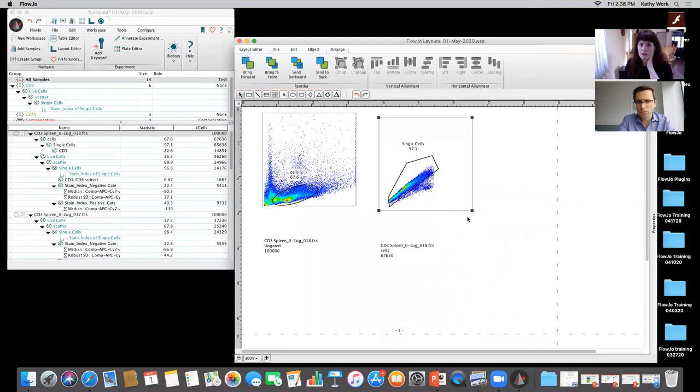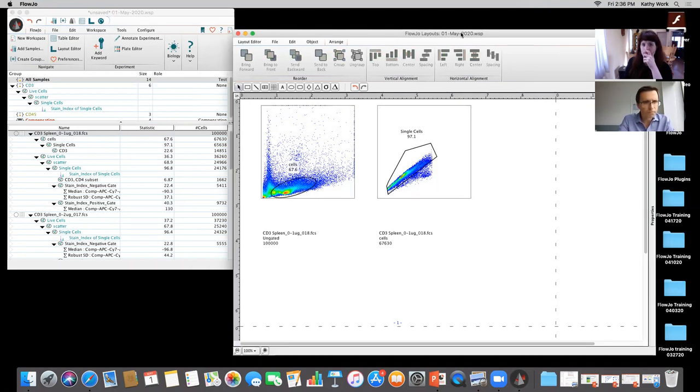But yeah, typically what you do to line things up is to drag them and align them to one specific top or bottom or whatever you're looking at, align it to, whether it's vertical or horizontal. Yep. And let me see. Yeah, I believe that's it.